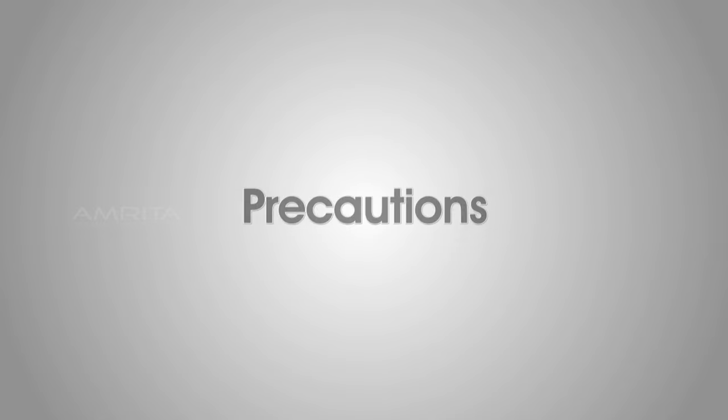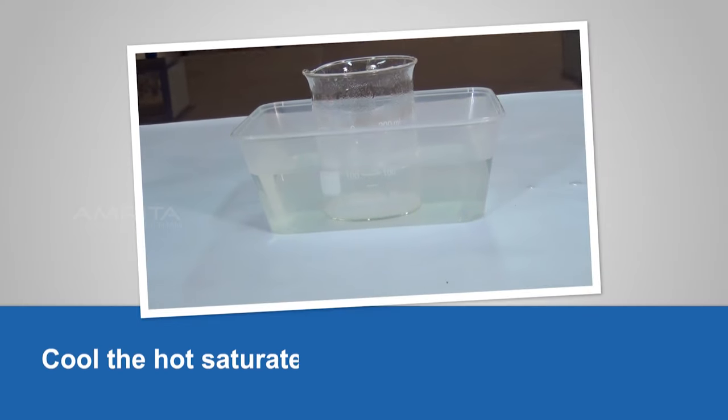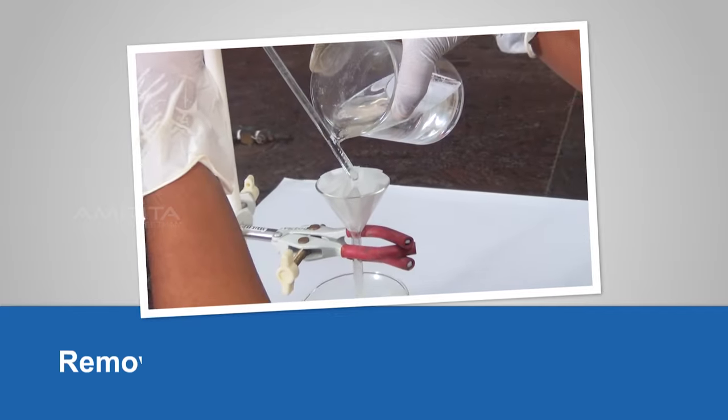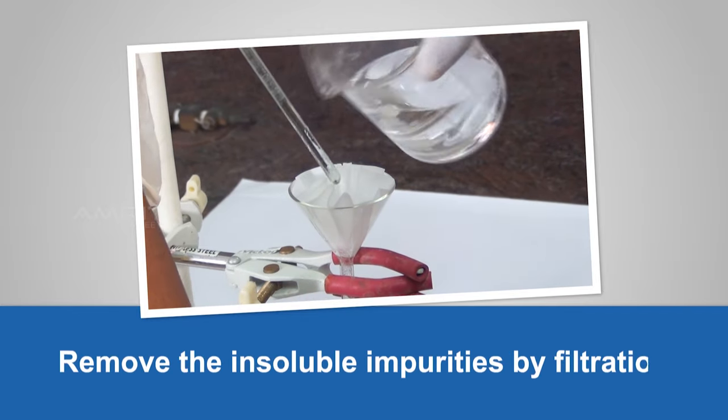Precautions. Cool the hot saturated solution without disturbing it. Remove the insoluble impurities by filtration.